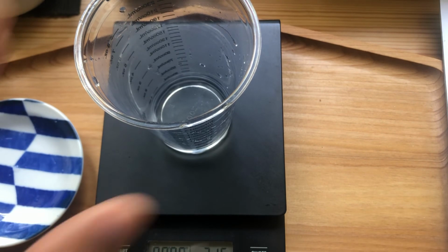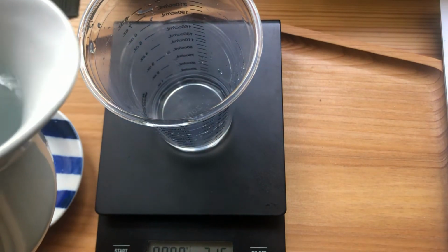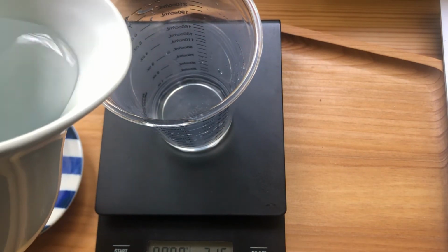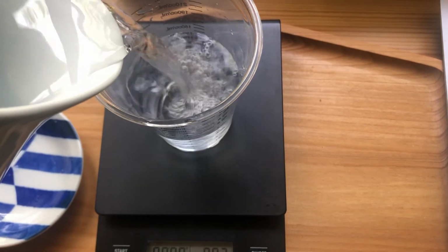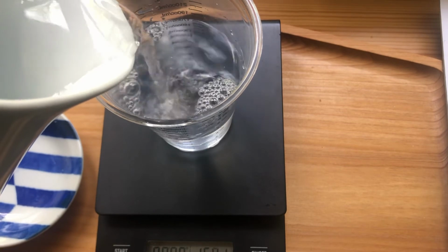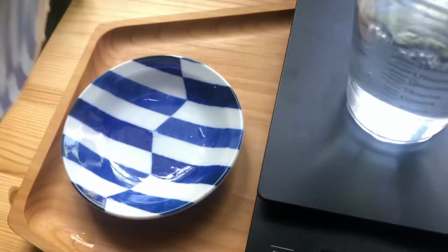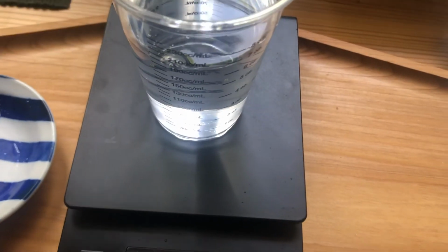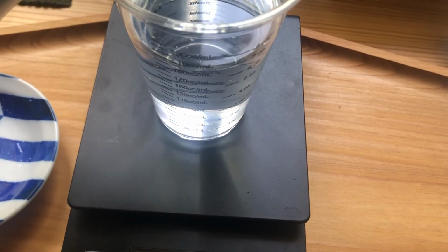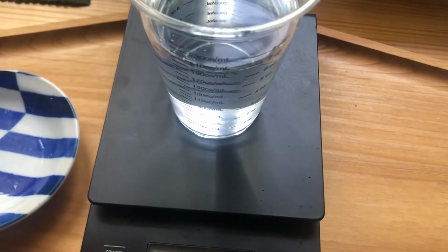All right. So what I'm going to do here is dilute it to 200 mils. I'm looking at my graduated cylinder on the side, and it's important to measure the volume until it's about 200 mils. I'm going to use the volume this time. So let's take a look here on the side. All right, it's about 200 mils. Close enough.